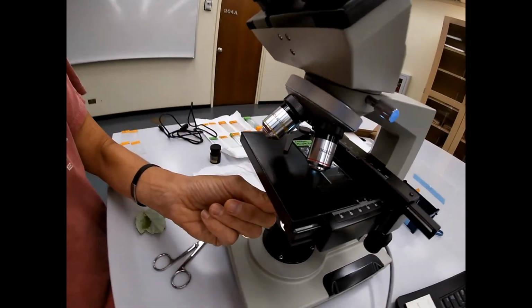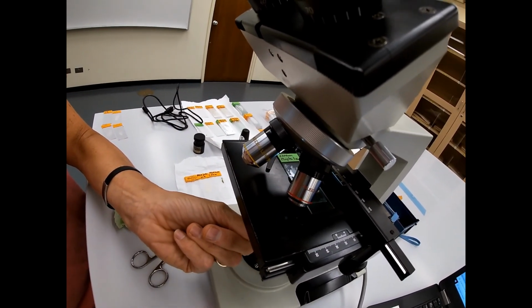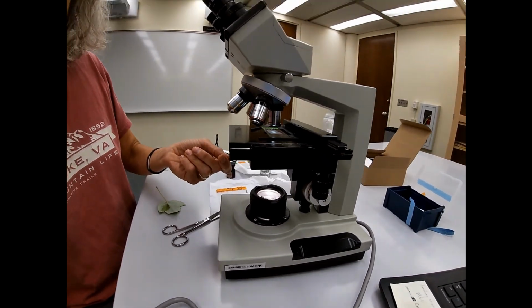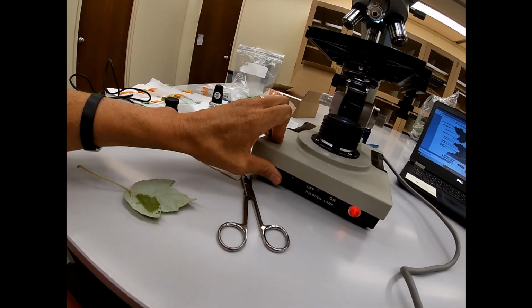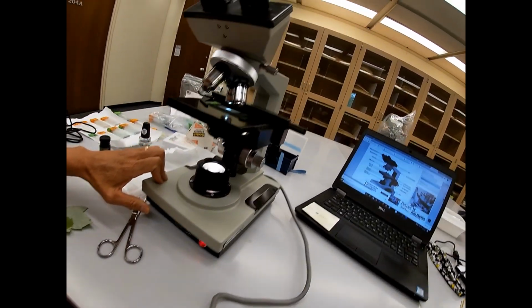So we're going to actually come up and look at that. Just look at how that gets brighter, and that would probably burn your eyeballs out, so be careful with that. I often work on it at very low intensity. And the last thing you should recognize is there actually is a way of making the light itself brighter as well as the diaphragm, the amount of light that's allowed to come through.